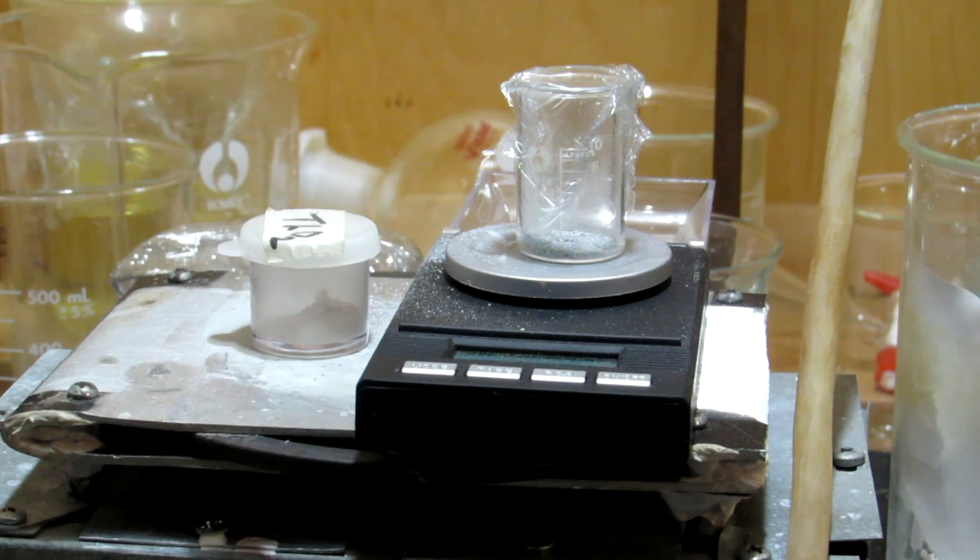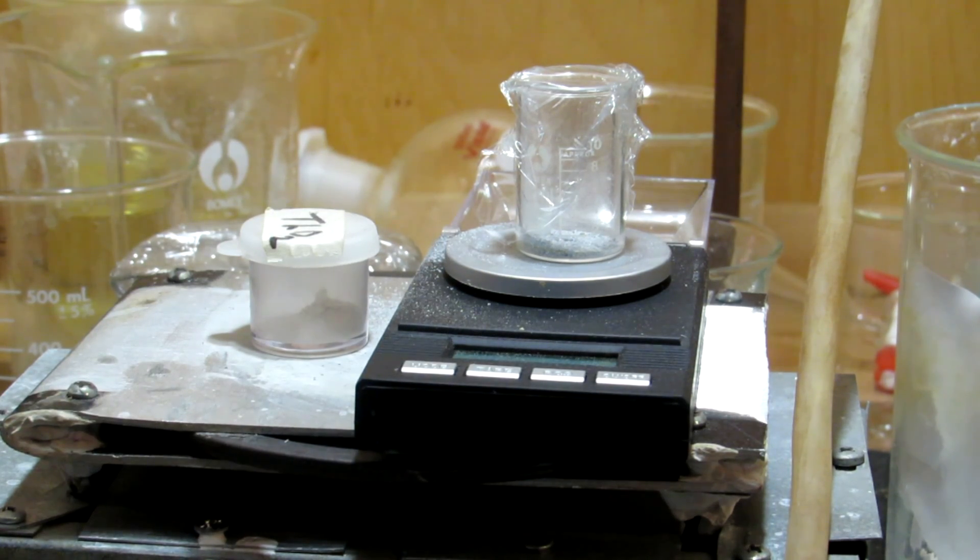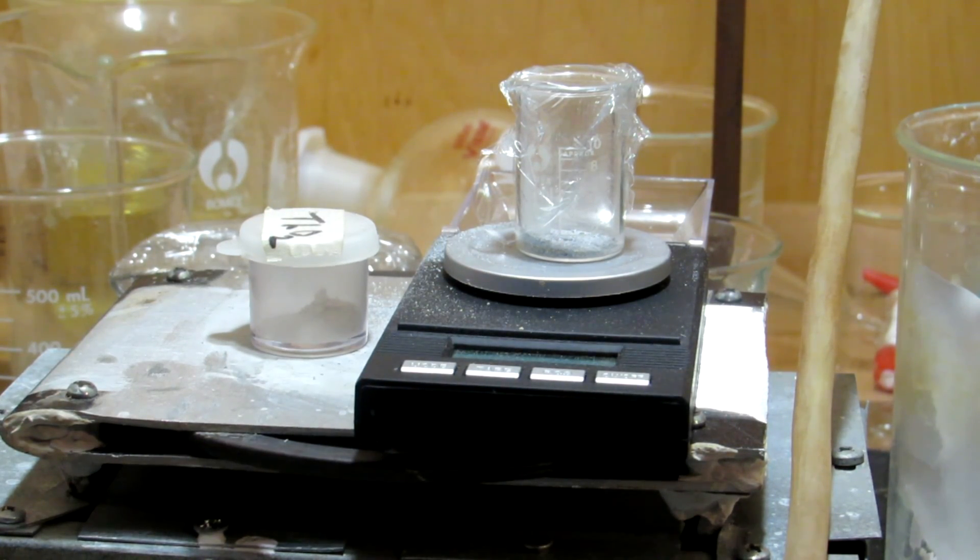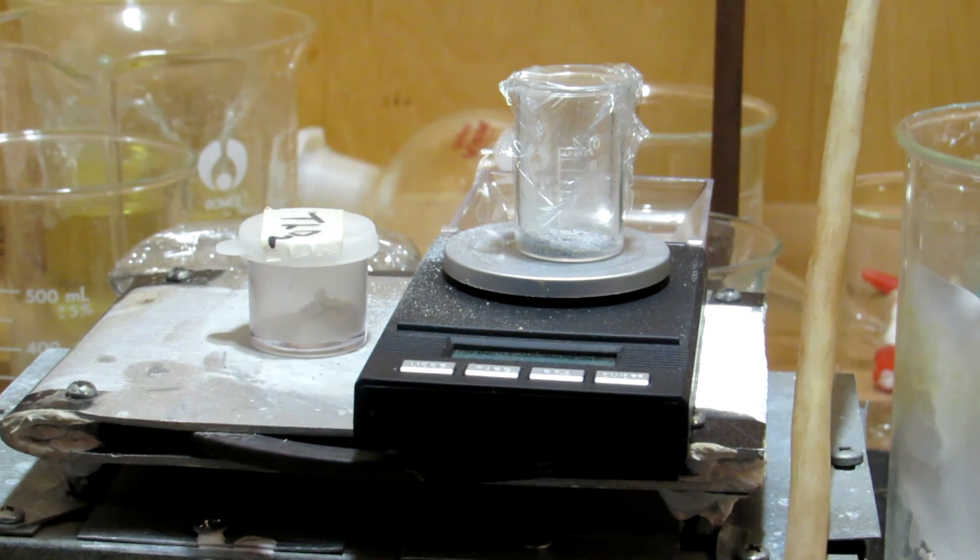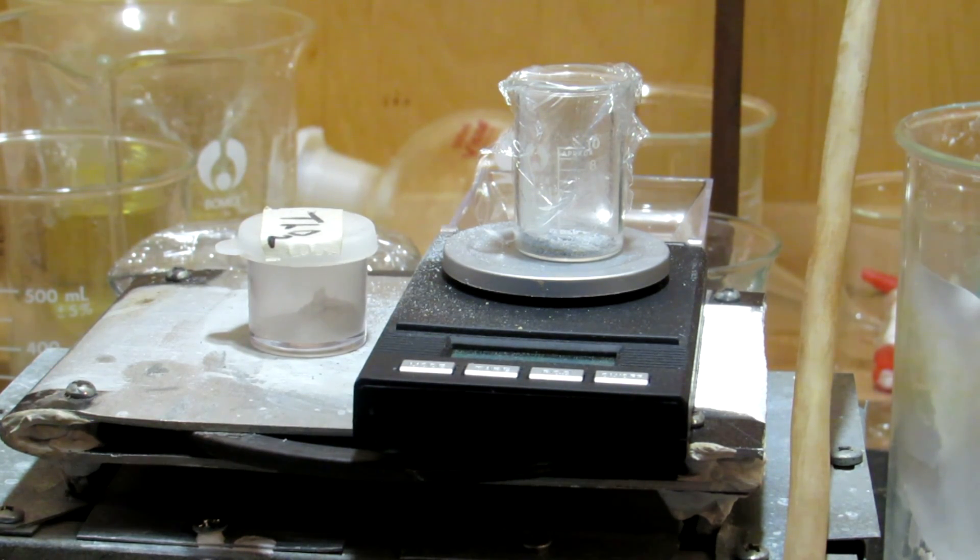This experiment was done back when I was in high school, and I took the thorium dioxide to school and borrowed their Geiger counter to ensure it was radioactive. It was slightly radioactive above background radiation, which is a good sign.